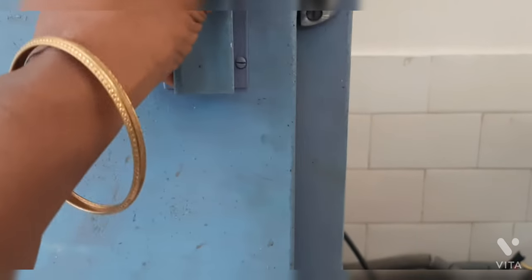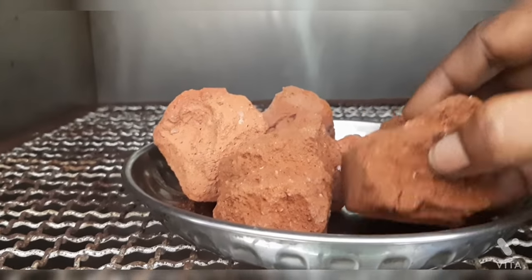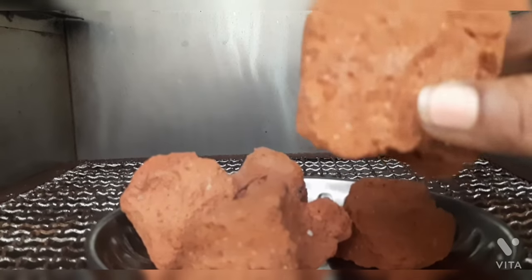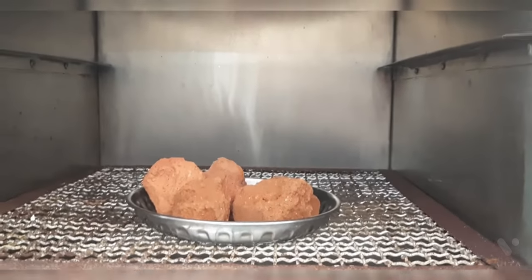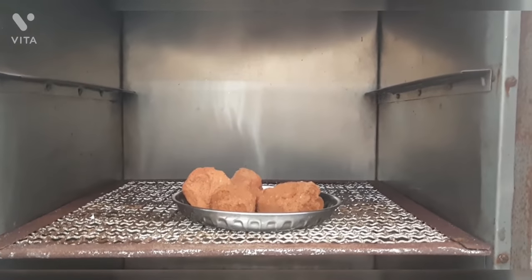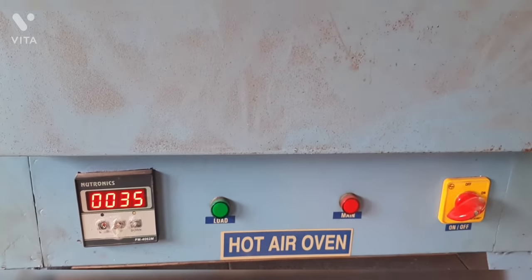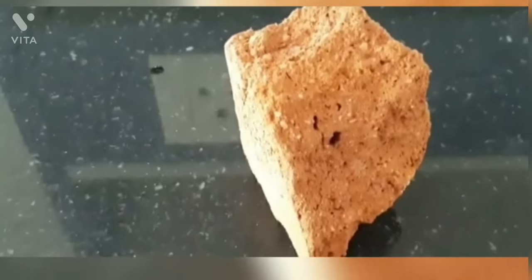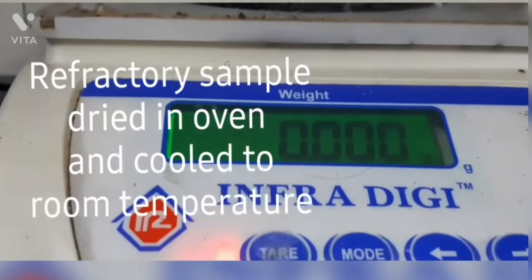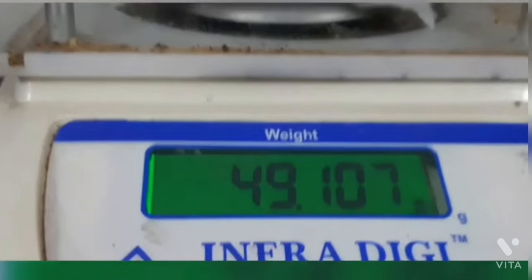As the first step in the determination of porosity, the sample bricks are washed thoroughly to remove dust particles, then kept in a hot air oven and heated gradually from 35°C to around 100°C. During heating, unwanted volatile substances and moisture are removed. To bring them down to room temperature, the sample bricks are kept in a desiccator — a glassy apparatus containing calcium chloride — to prevent further adsorption of moisture from the atmosphere. Once at room temperature, the sample is weighed, and this particular sample piece weighs around 49.1 grams.